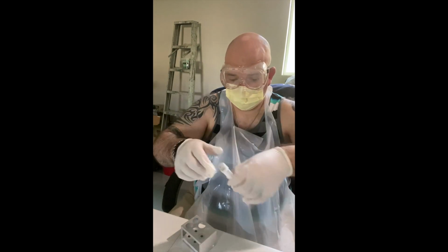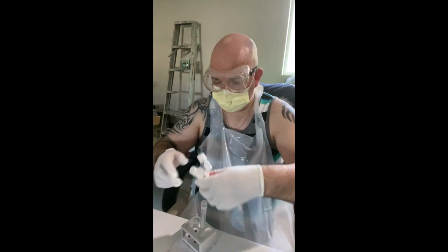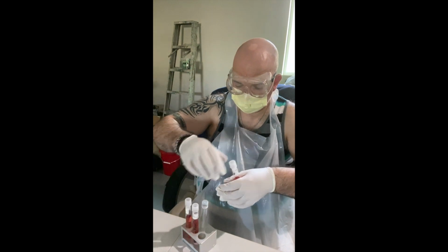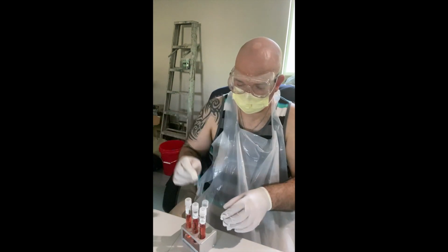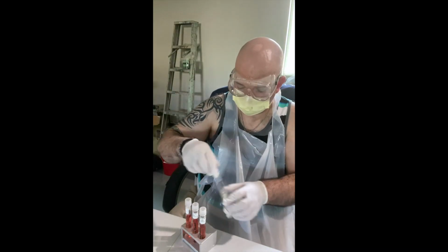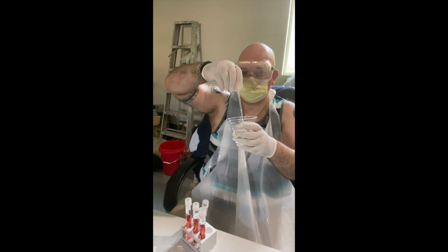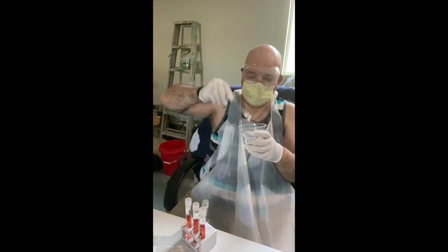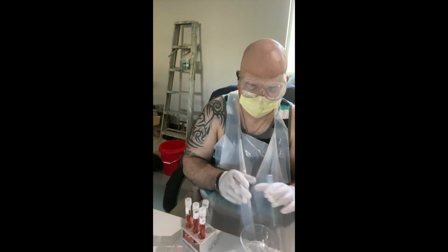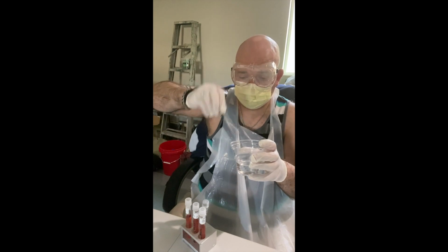And I'm going to do the same thing for the S. cerevisiae cultures. The S. cerevisiae phenol red tubes with the different sugars. Okay. So this is my S. cerevisiae culture. I'm going to remove this other pipette from the alcohol, squeeze out the alcohol completely. And just make sure that it's incredibly free of alcohol so that it doesn't kill the bacteria, the microbes.